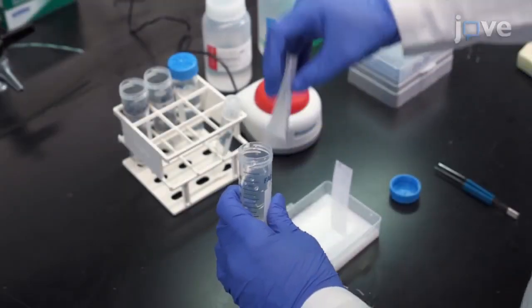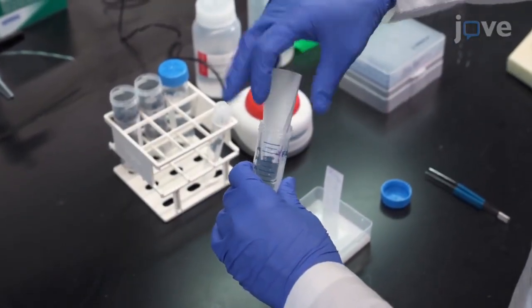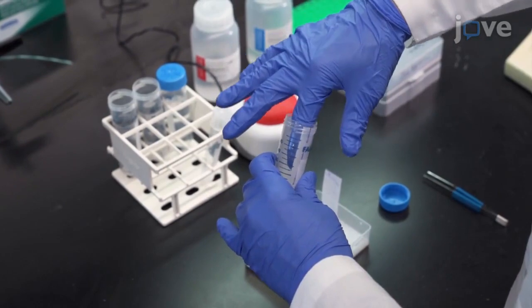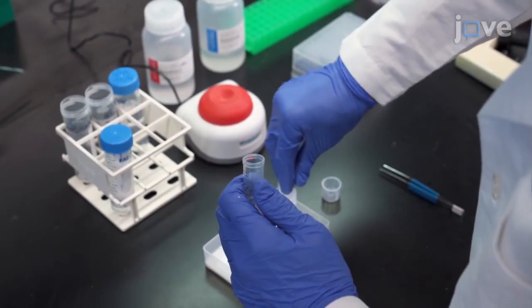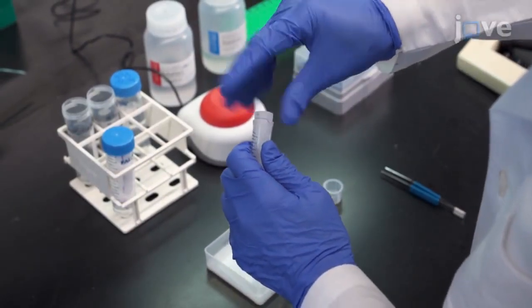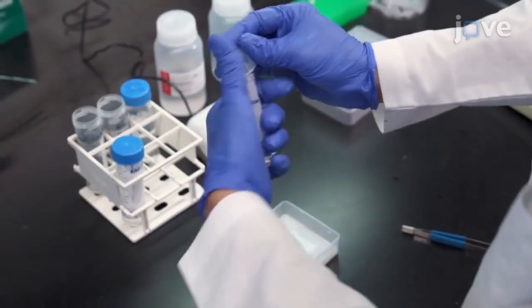Insert the membrane into a conical tube with primary antibody, ensuring that the entire membrane adheres to the wall of the tube and that the side of the membrane that was originally in contact with the gel is facing inward. Cap the tube tightly.